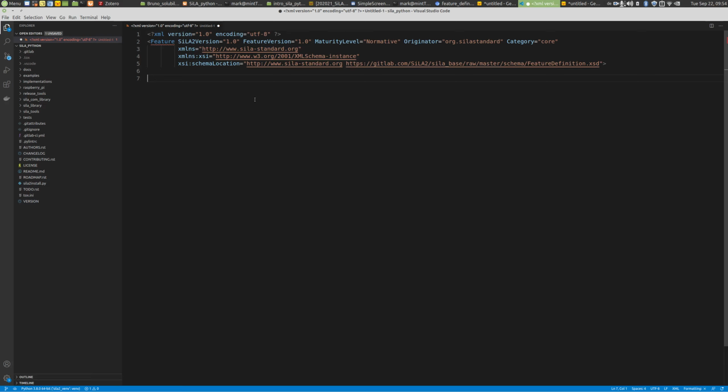And then you can see already it's very helpful to close this feature. So I opened the feature tag and now closing it. The nice thing about this IDE is that it really supports you in developing it. So if I open a tag, let's just do it, you see it already proposes possible options.